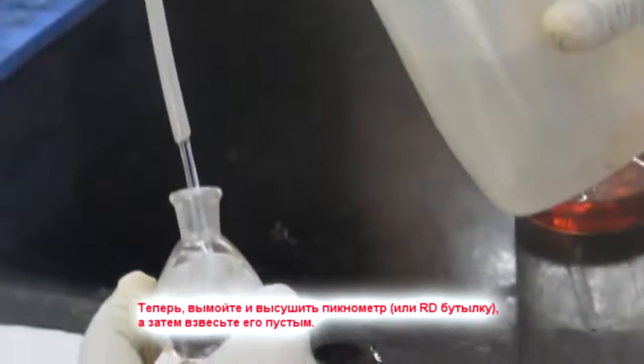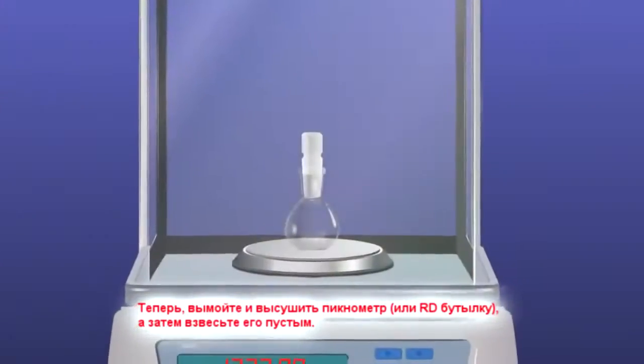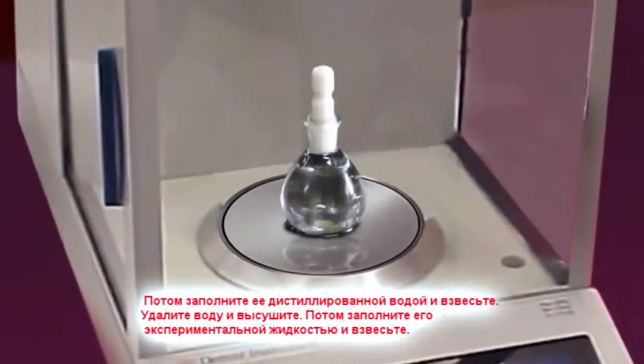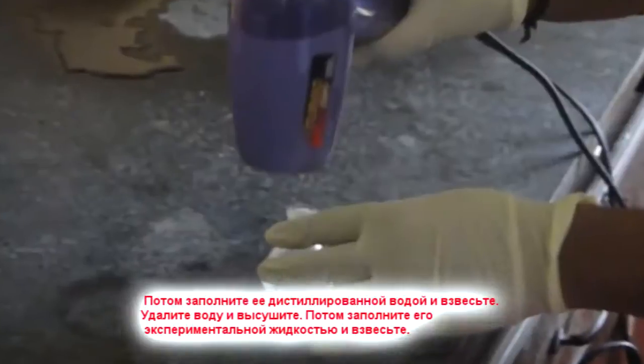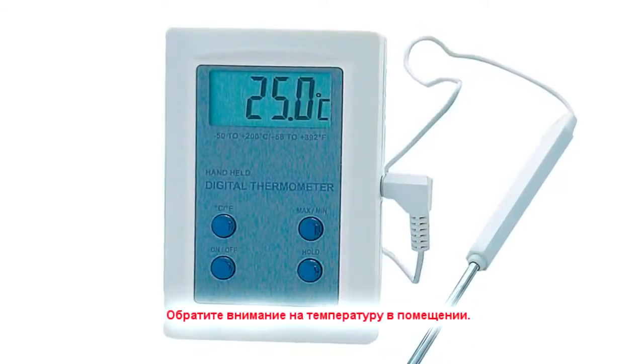Now wash and dry the pycnometer or RD bottle and then weigh it empty. Then fill it with distilled water and weigh. Remove the water and dry. Then fill it with the experimental liquid and weigh. Note the room temperature also.